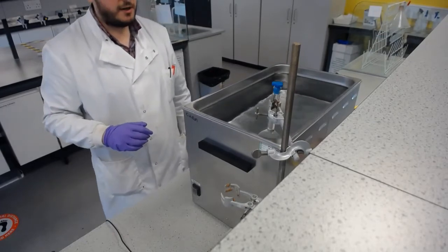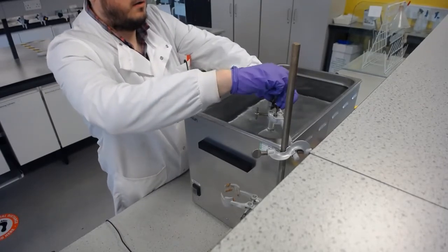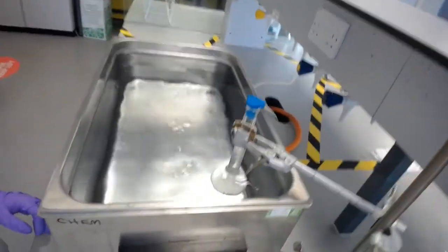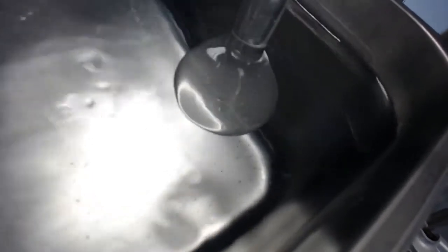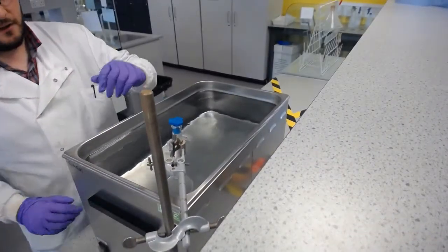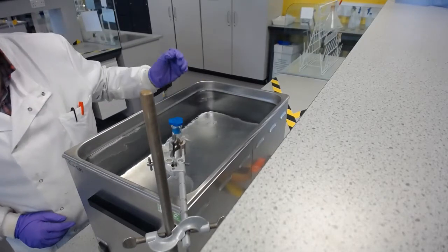So I'm just going to move the camera in here, just so you can see. But we do, in fact, this is quite a strong bath, actually, stronger than I had imagined. We do indeed have cavitation in the solvent there, and you can see that it's forming bubbles inside the flask. And there we have the exact safe reason why I shouldn't plunge my hand into this bath. So, actually a perfect example there, and we do need to be careful that this doesn't start to boil, in which case we would need to make sure we loosened off the lid so we didn't have any pressure build up.